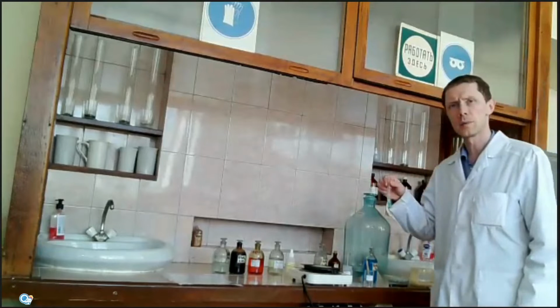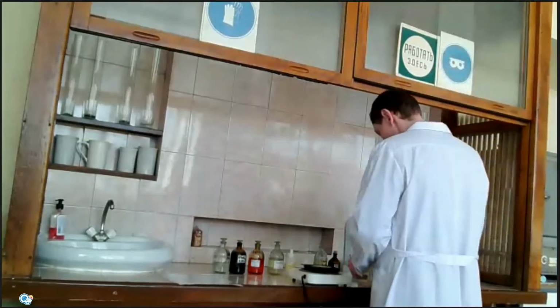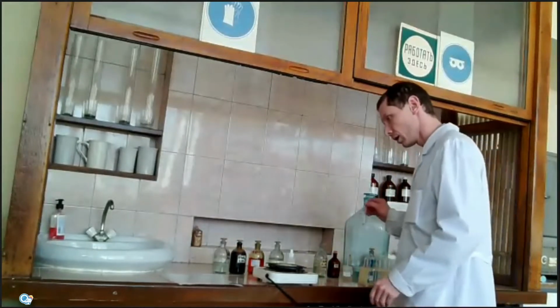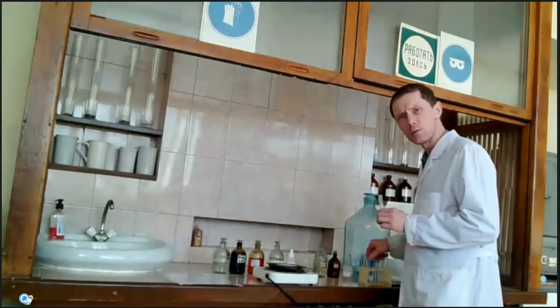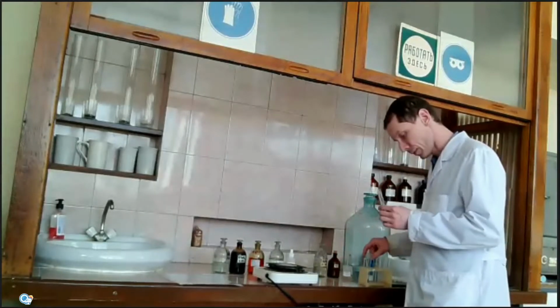Let's put it in a tube stand, and we will return to this experiment later. Let's do our experiment. At the end of our lab, we will return to this experiment.